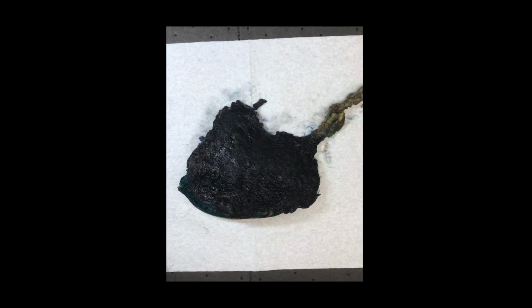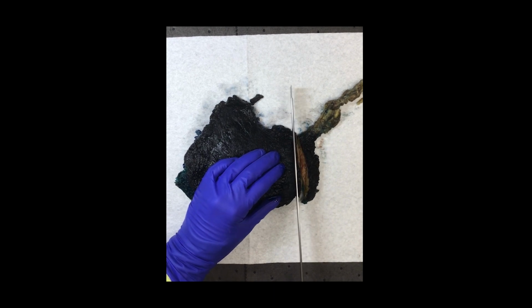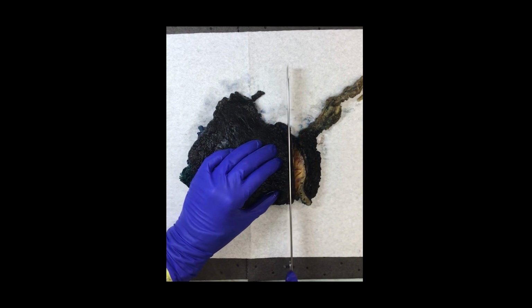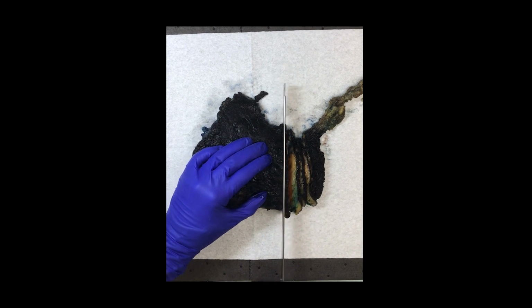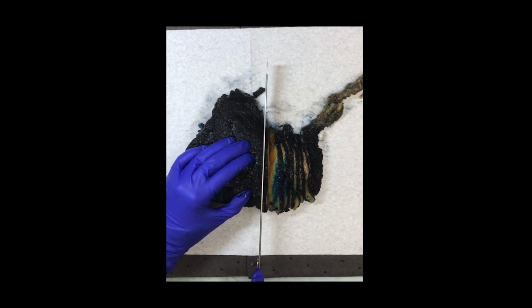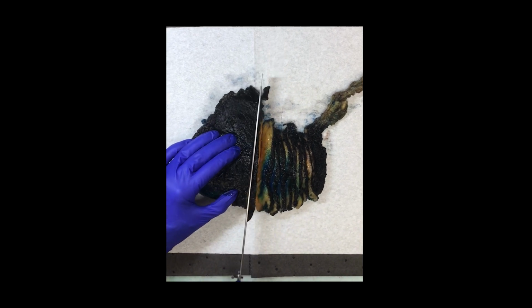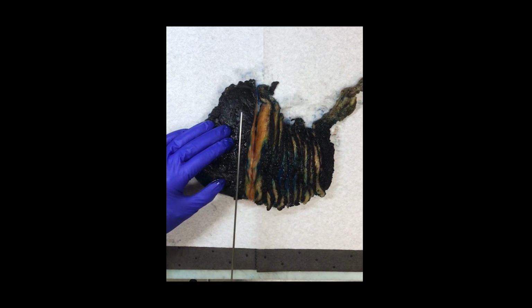Now that the specimen's all inked, we're going to move into the cutting. So I want to make sure that I leave my end margins, so my medial and lateral ends, a bit wider, about 2 centimeters. And then my in-between slices, I'm aiming for 0.5 centimeters in thickness. And I want every slice to be even thickness. And I want to be cutting all the way down to the back of that skin that was on the anterior side. So if you imagine, it's kind of like a book with the skin being the spine of the book, and then the slices that I'm creating being the pages of the book.